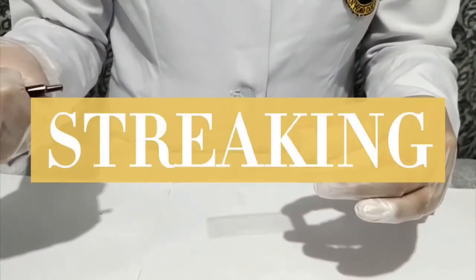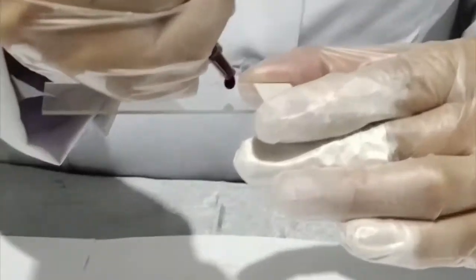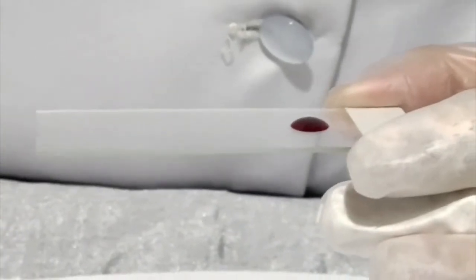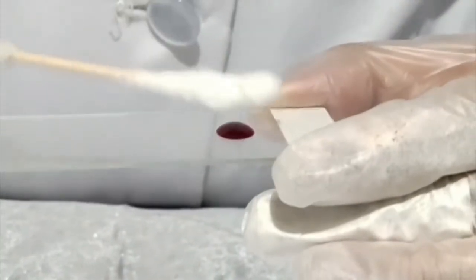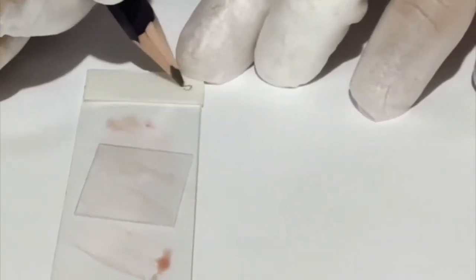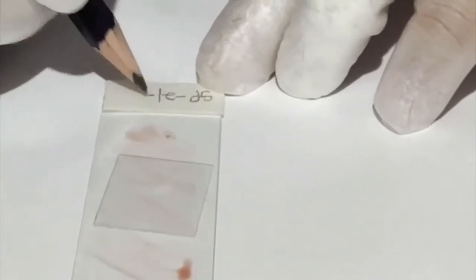The first method of smear preparation is streaking. Pour a small amount of the sediments on one end of the glass slide, and by using an applicator stick, streak the sediments in a zigzag line throughout the remaining length of the slide. A relatively uniform distribution of the material should be obtained. And then, cover it with a cover slip. After that, label your slide: type of specimen, current year, and the specimen control number. And then, you have it.